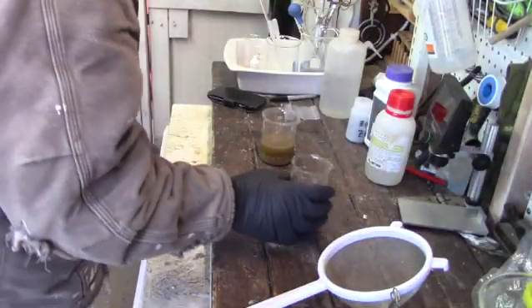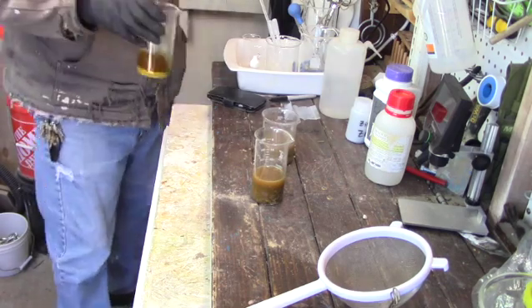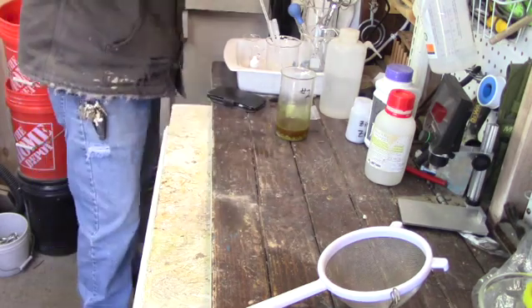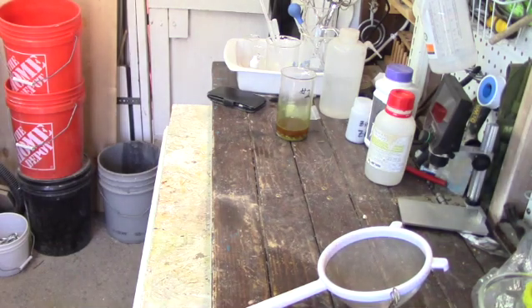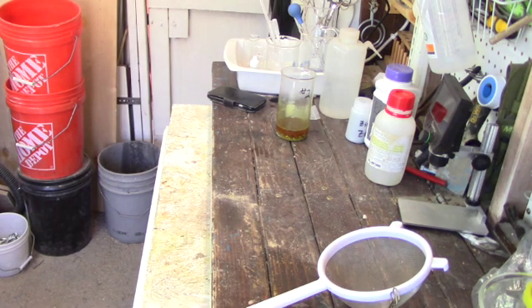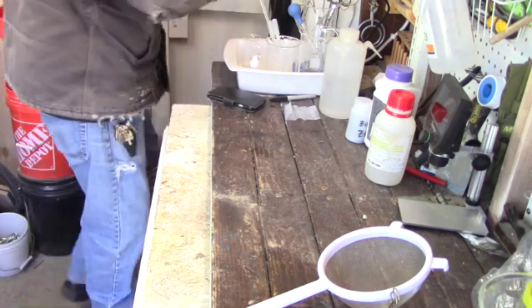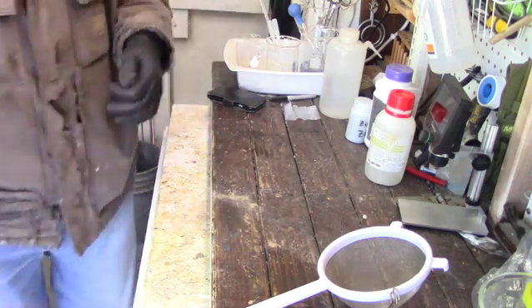So I've got all three samples now juiced up with muriatic acid. We'll stir them up, put them in the heat, and let them cook for a while. Apparently the second sample had a bunch of sulfides in it, because you see me suddenly clear out of the room. I got a whiff of sulfur gas, so I cleared out and caught my breath. When I came back into the room, I was holding my breath, grabbed the beaker and stirred it some more, then put it in the fume hood, then left the room again to fresh air and let the room air out.